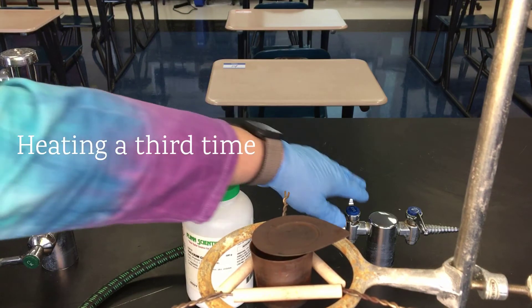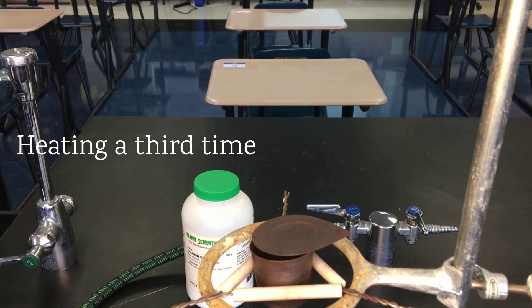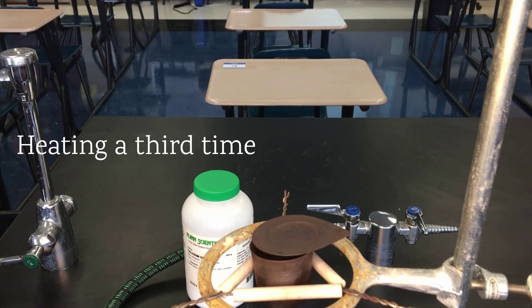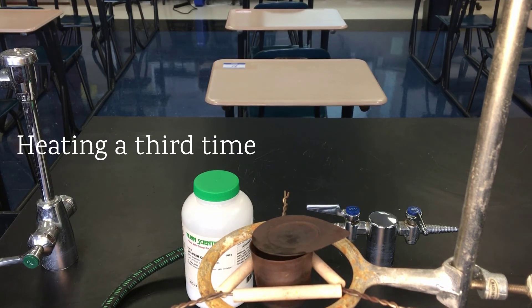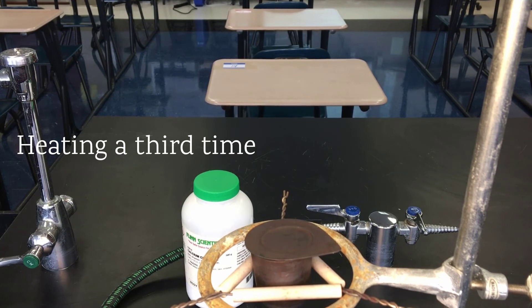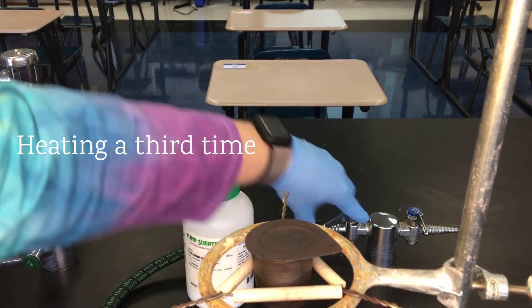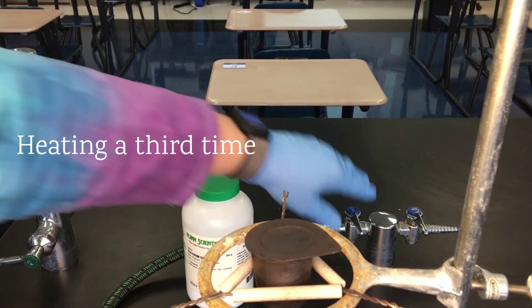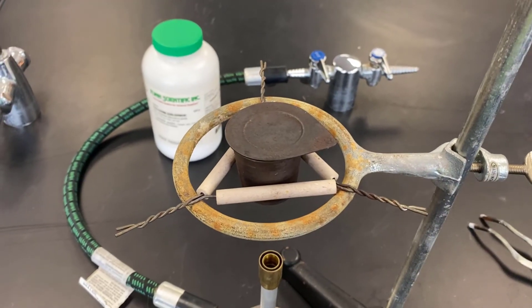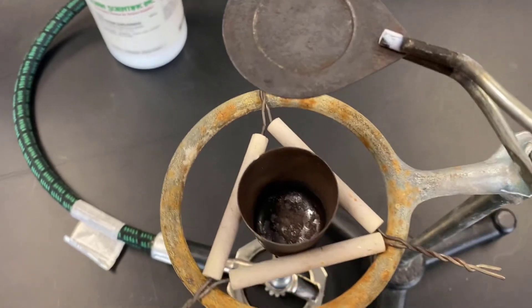When we heat it the third time, we're only going to heat for about two minutes. Again, we'll allow it to cool, and then we'll go ahead and get the mass. Because of time, this will be our final measurement, even if a fourth successive weighing would be warranted.